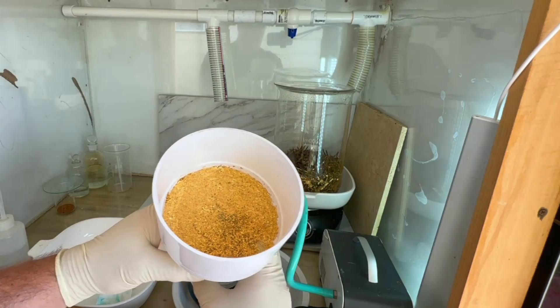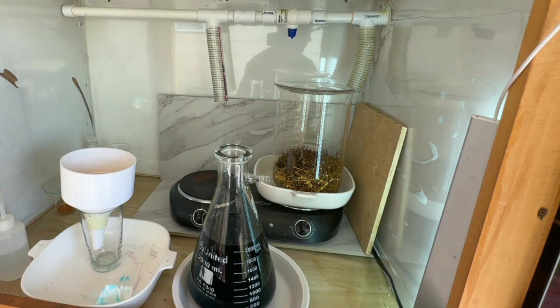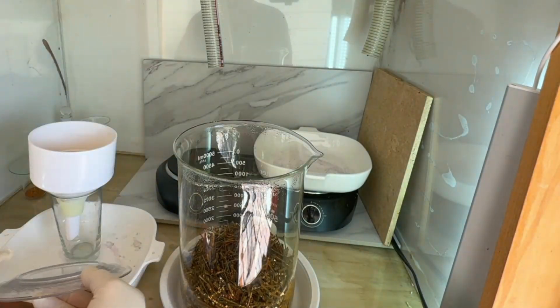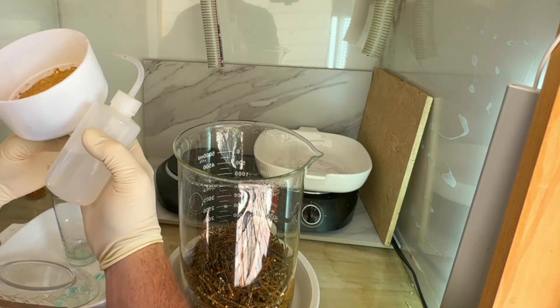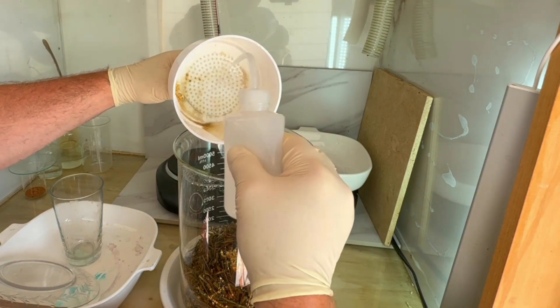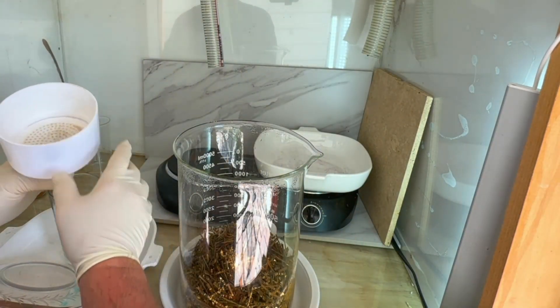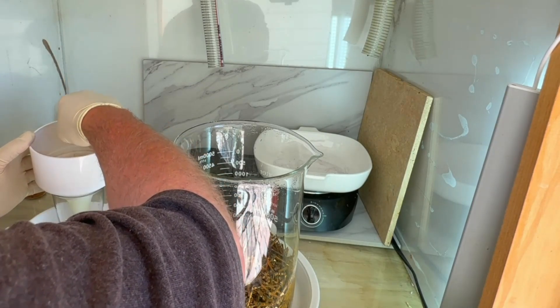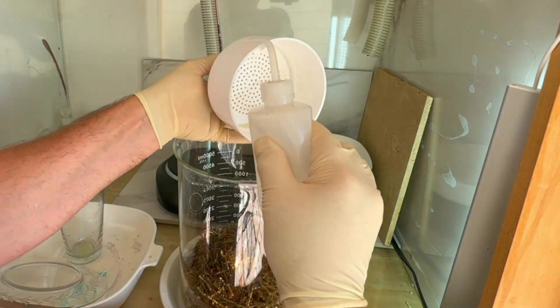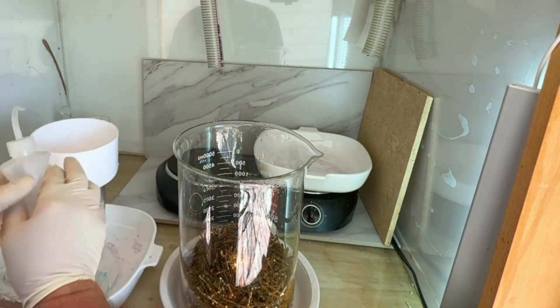You can see we've got plenty of foils in the filter and funnel here. We'll take our beaker of fingers and foils, grab our filter, and rinse these foils back into the beaker. There are a few stuck underneath the edge of the filter paper, so we'll pull that out and rinse those in to make sure we get them all. Double-check the funnel to get anything stuck in there — looks good, time for the next step.